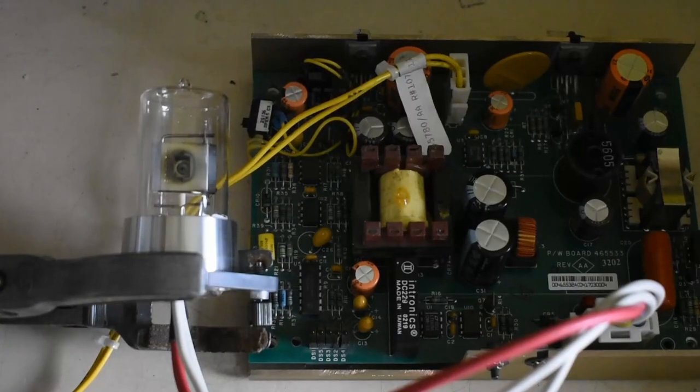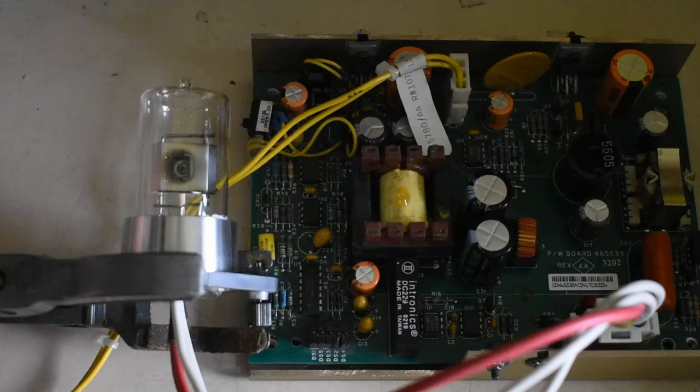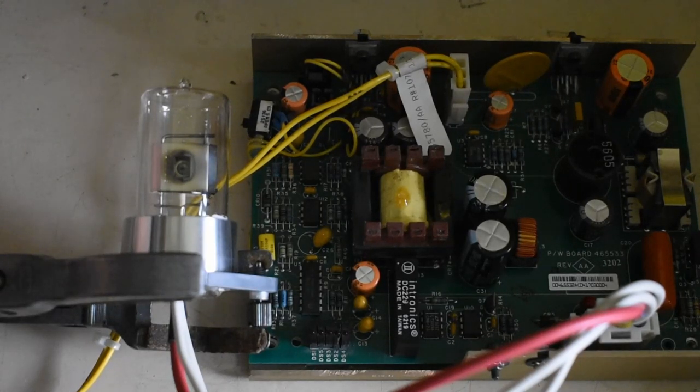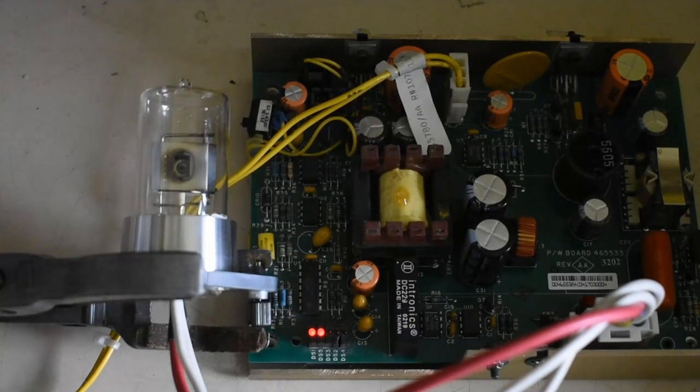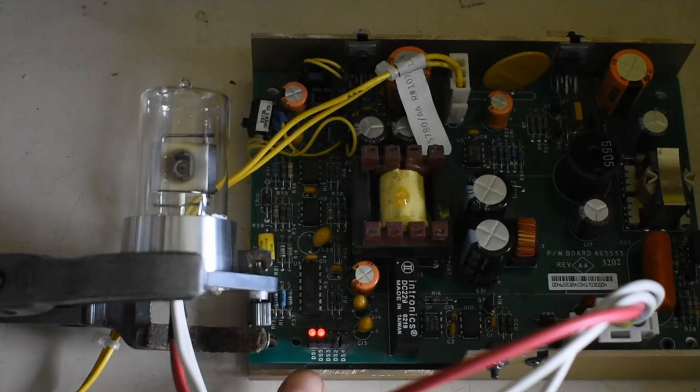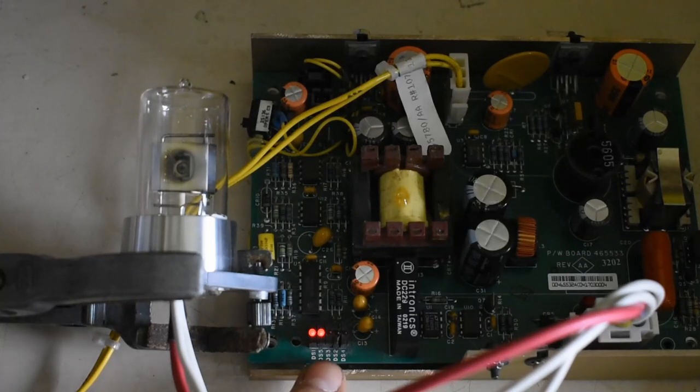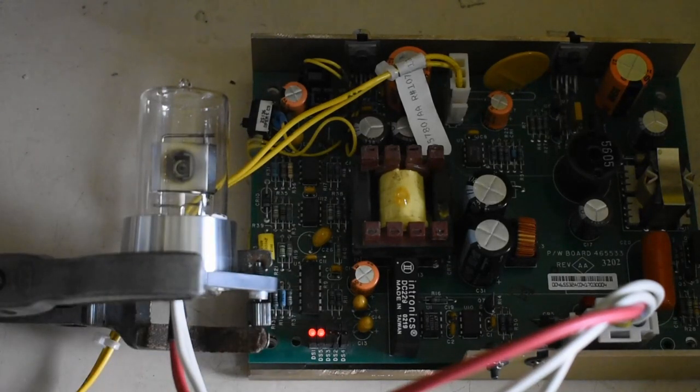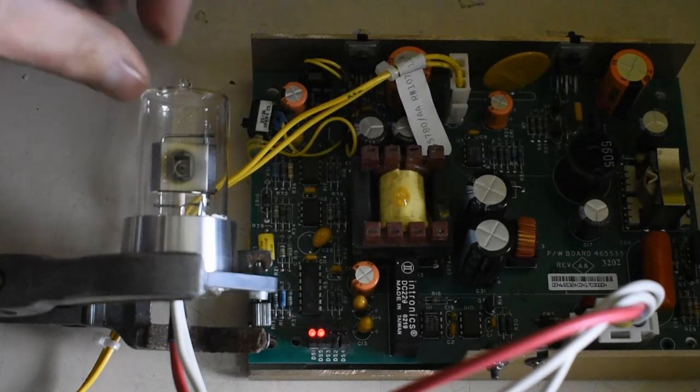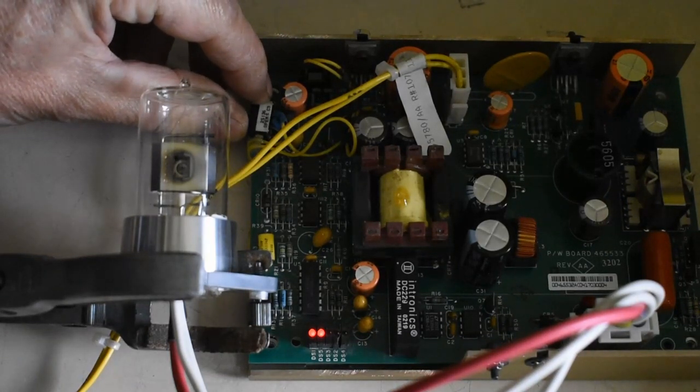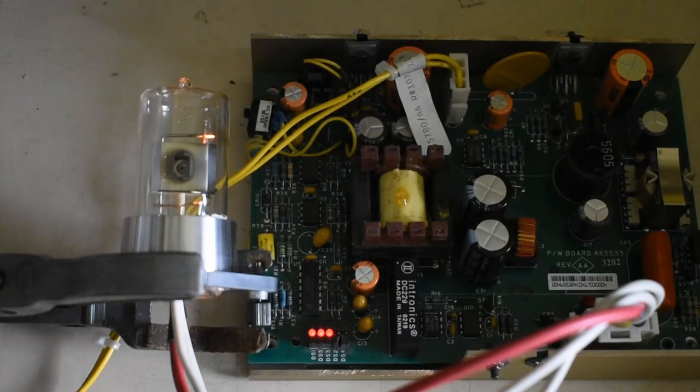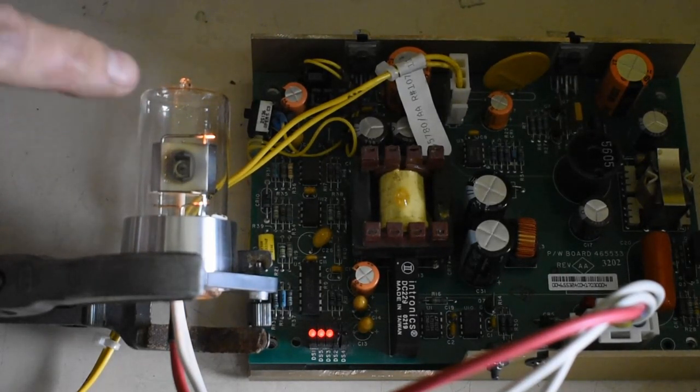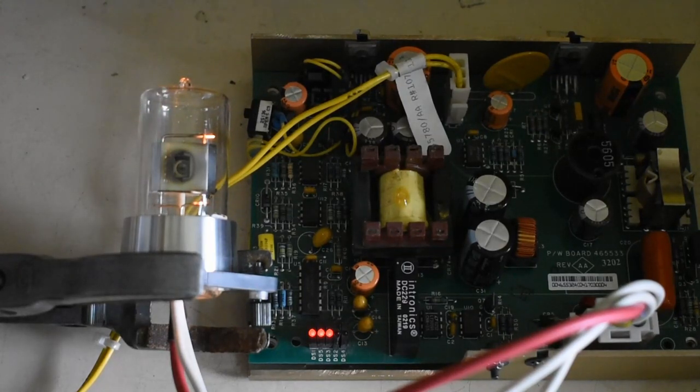Okay, I'm going to connect this up to its supply. Primarily you'll see these two LEDs have lit up indicating the 24 volts is present and also the anode voltage from the inverter is present. And if I then switch the input here to proceed, that means the heater is now lit up. You can actually see the heater cathode starting to glow.